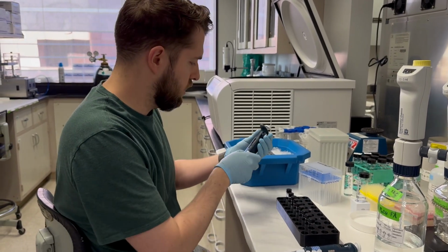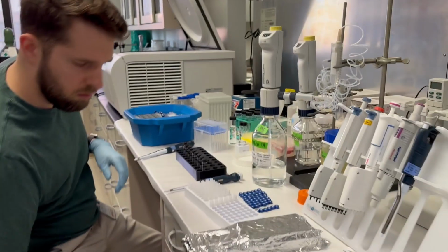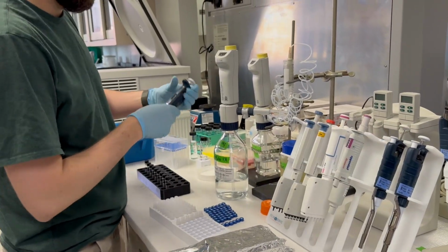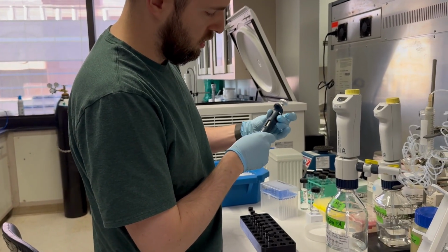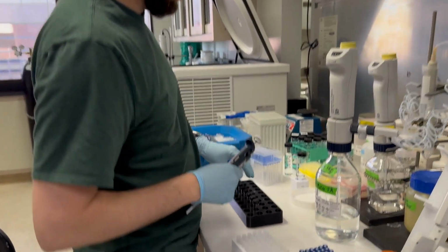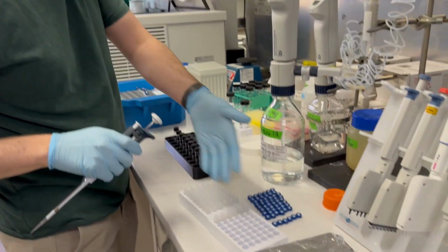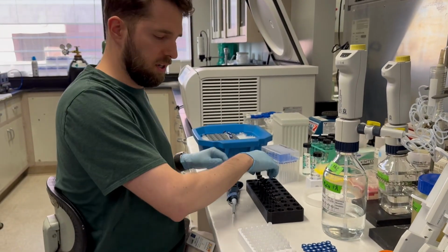Okay, 600 divided by 6. Actually, I'm going to get a different pipetter. Let's see, what's this? That's 100. So I'm going to do 90 microliters in each one. In theory, we have 600 microliters in each one of these 4 ml vials, so we'll have enough material to distribute here, and then we'll have a little bit left over, or just some is going to get stuck on the walls and whatnot.